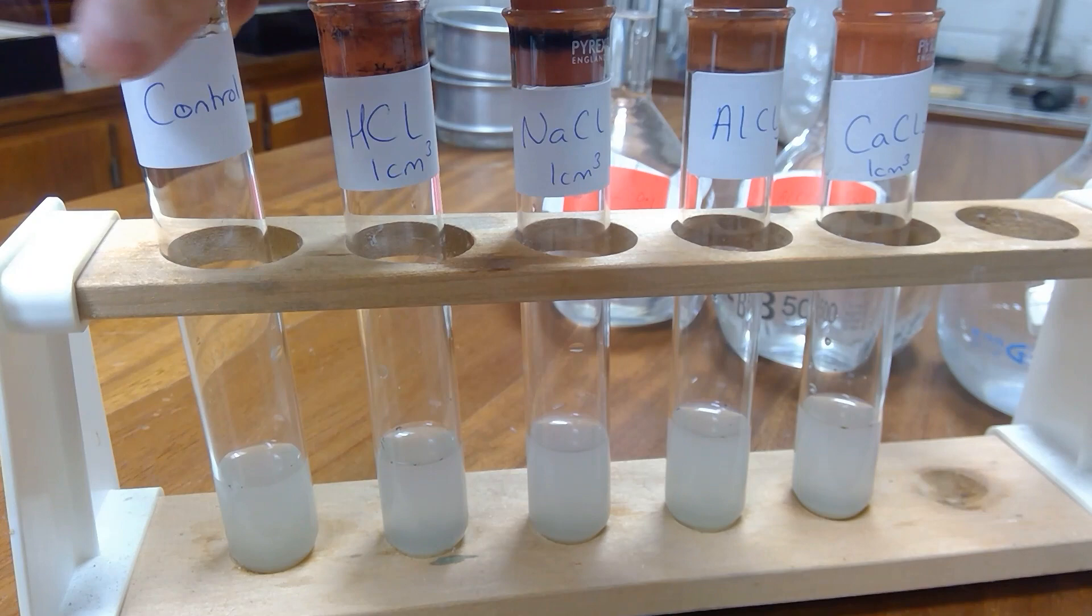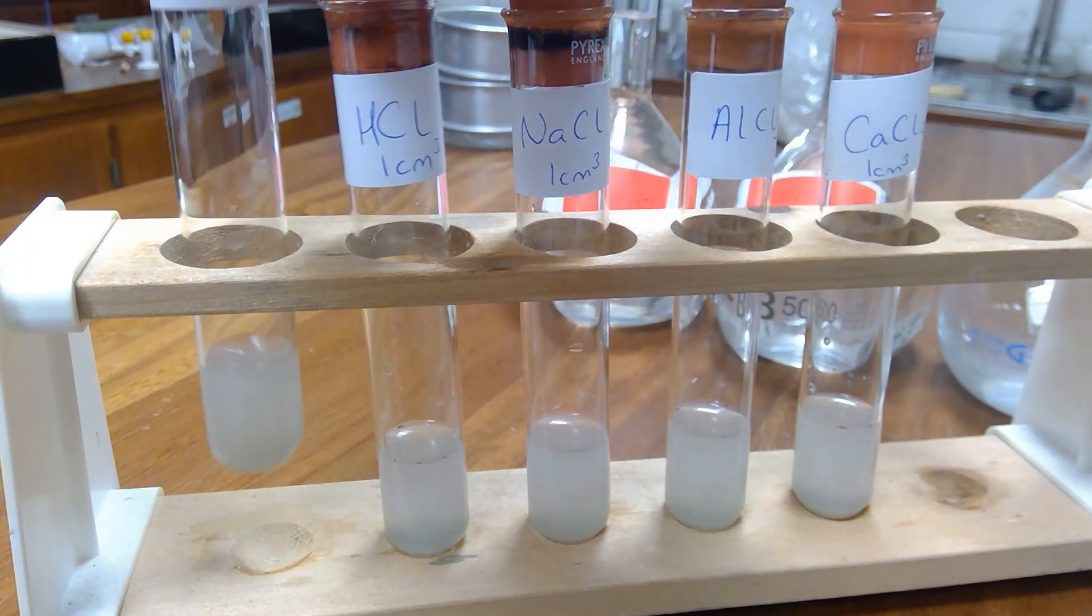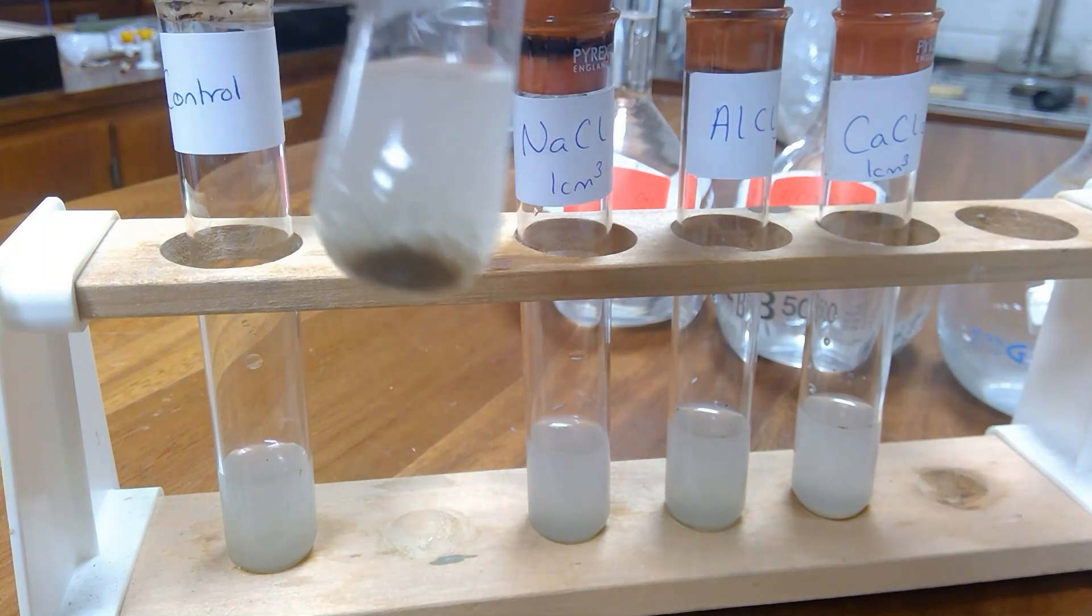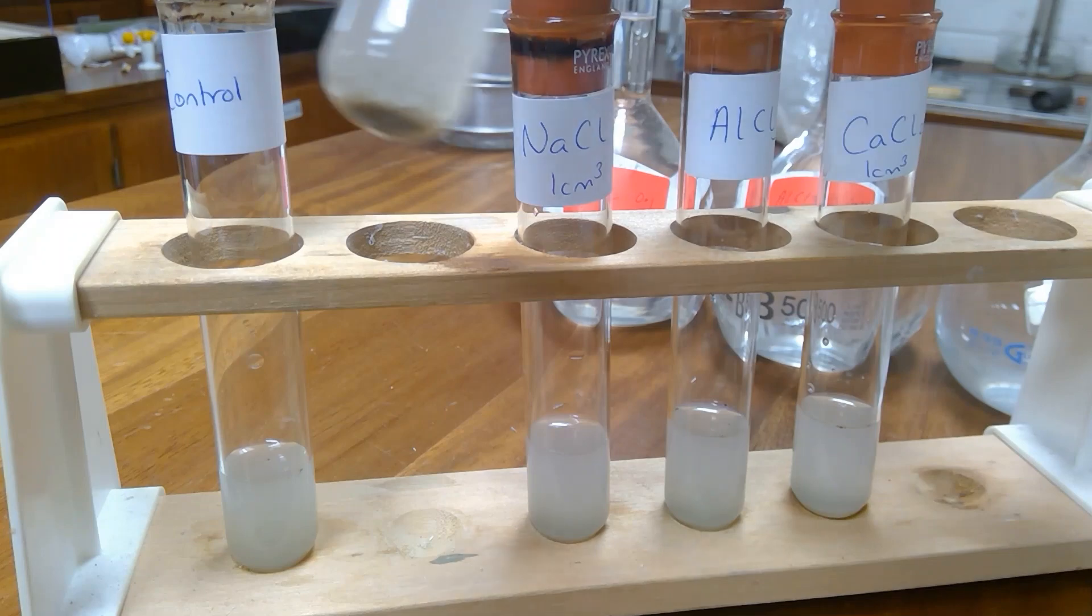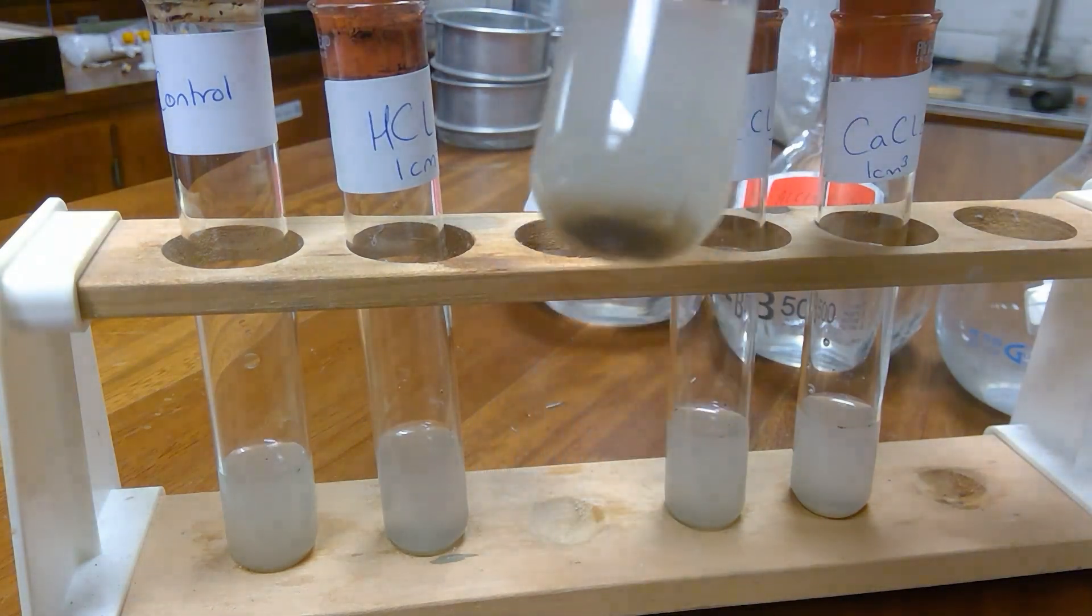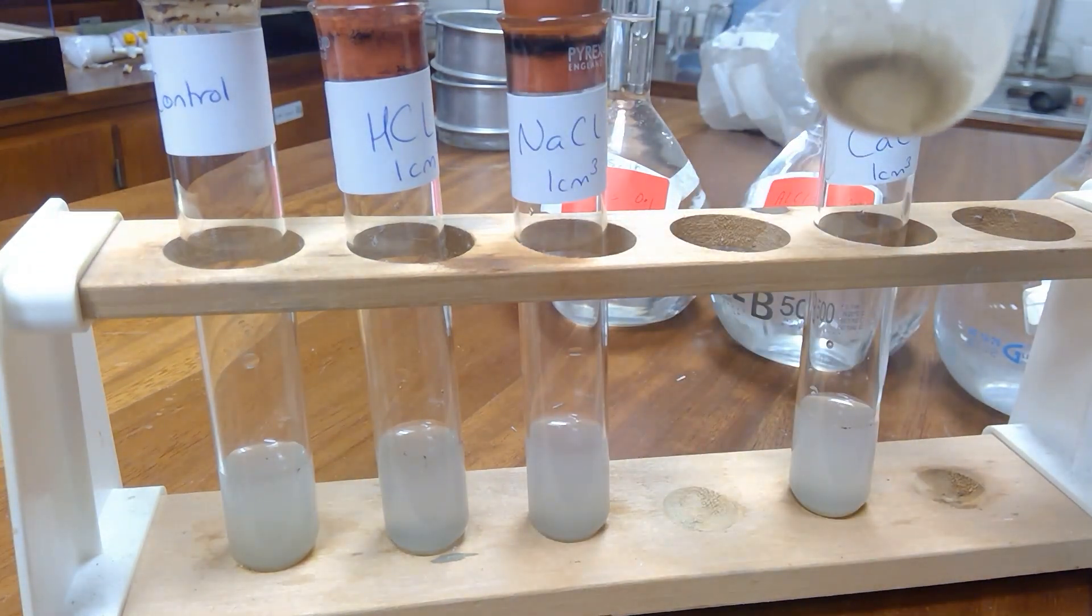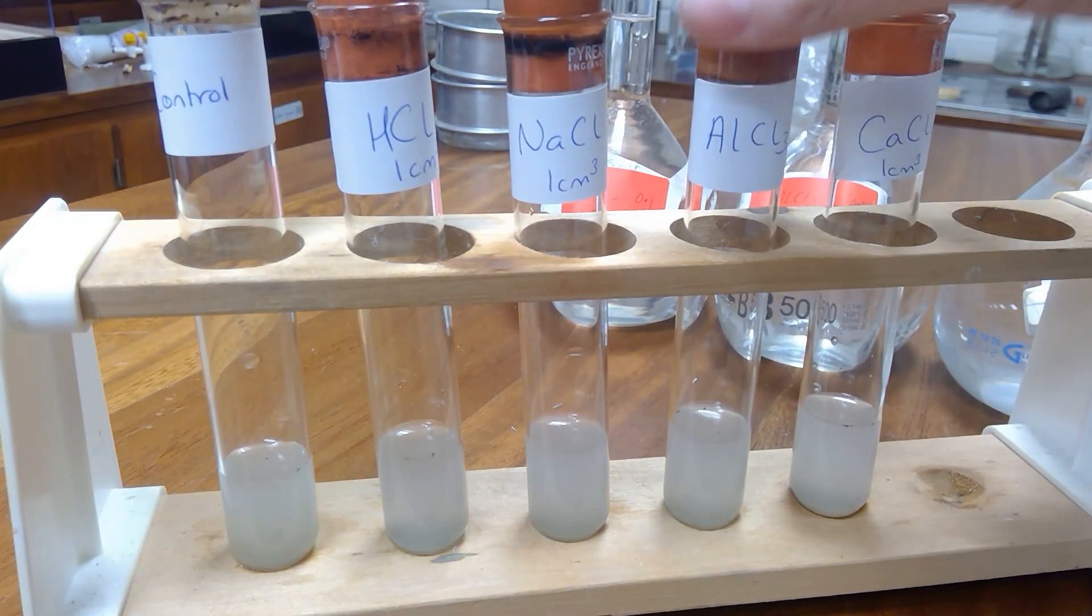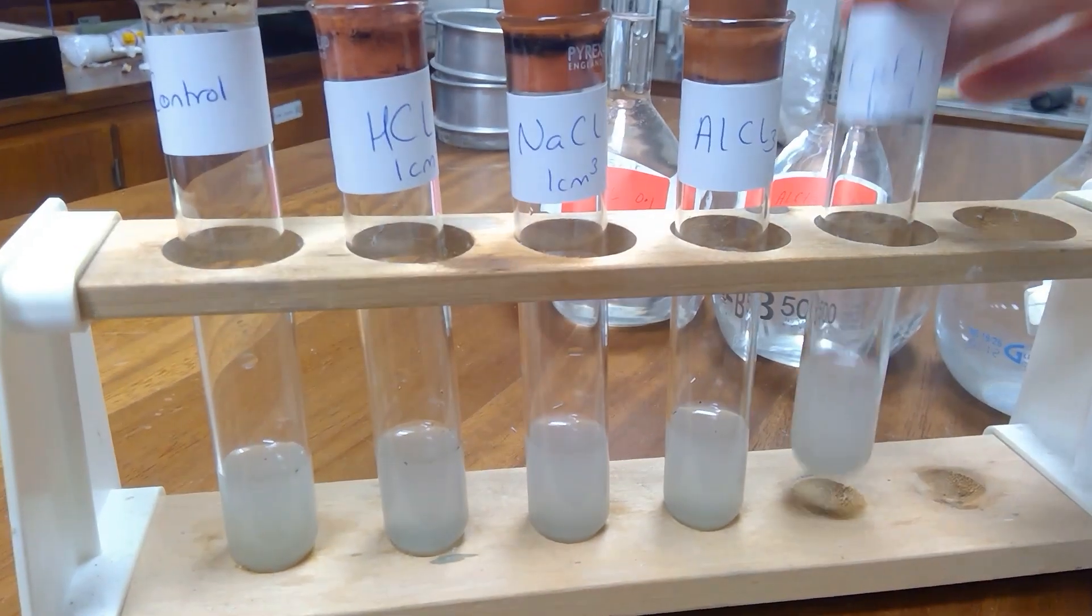After 10 minutes, control, hydrochloric acid, sodium chloride, aluminium chloride, calcium chloride.